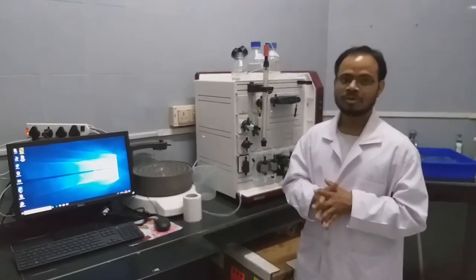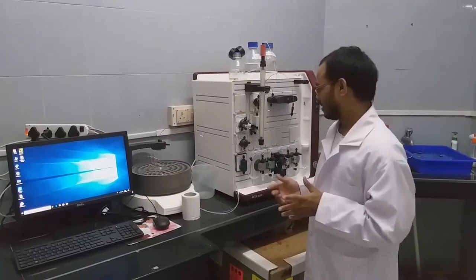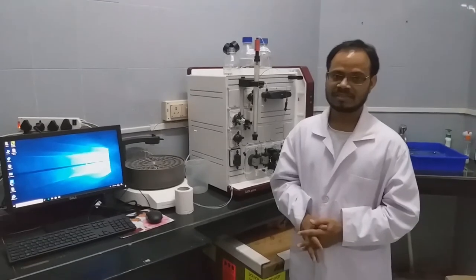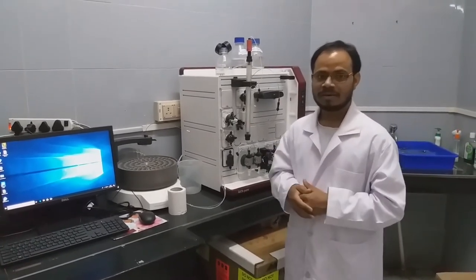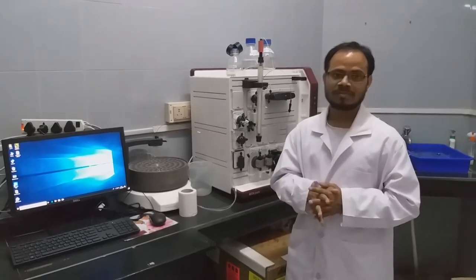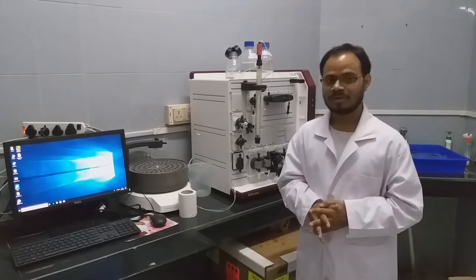In this video, we will show how this instrument can be operated. In our lab, we are using the ÄKTApure M, which is from GE Healthcare Sciences. All the components we show here are similar to those in other instruments or other companies' instruments as well, though only the architecture of the instrument changes.